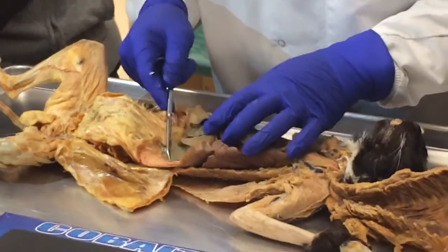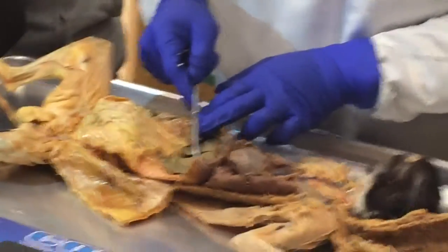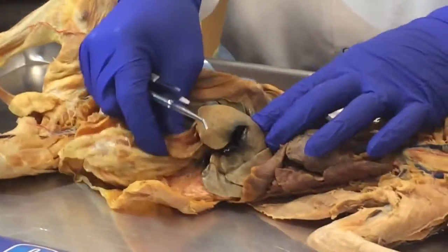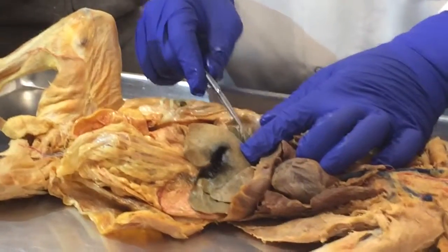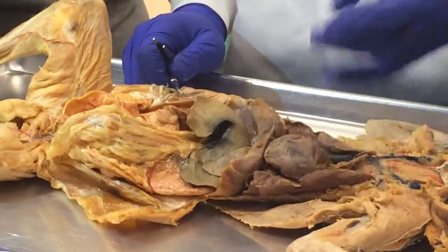And so, of course, this is the left lateral lobe. And then the left median lobe and the right median lobe. And the only one you really have to search for, which is right here, this is the right lateral lobe. So that makes the 5. Caudate.